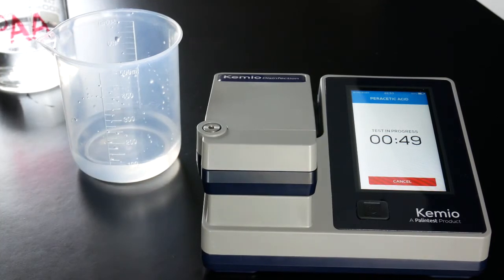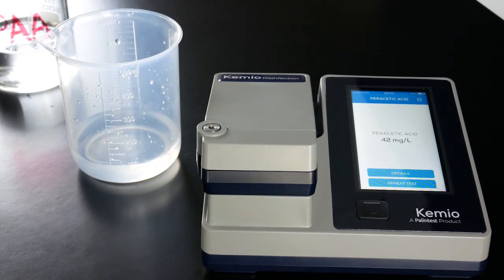After one minute, a reading will appear and if you have set up labels, then you will also get a pass or fail.